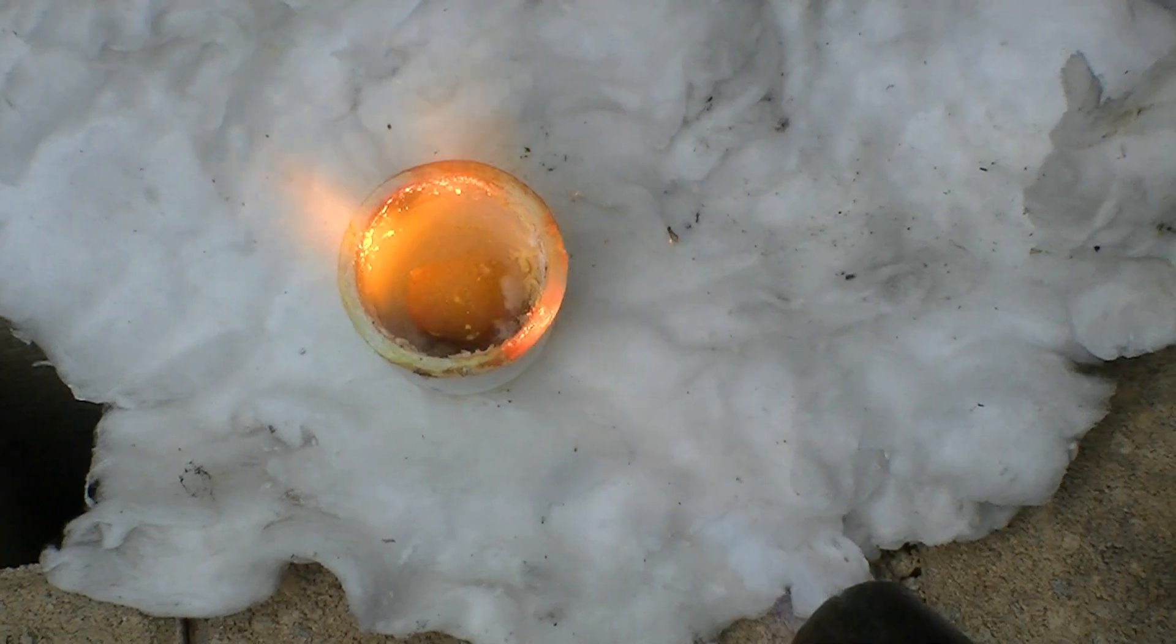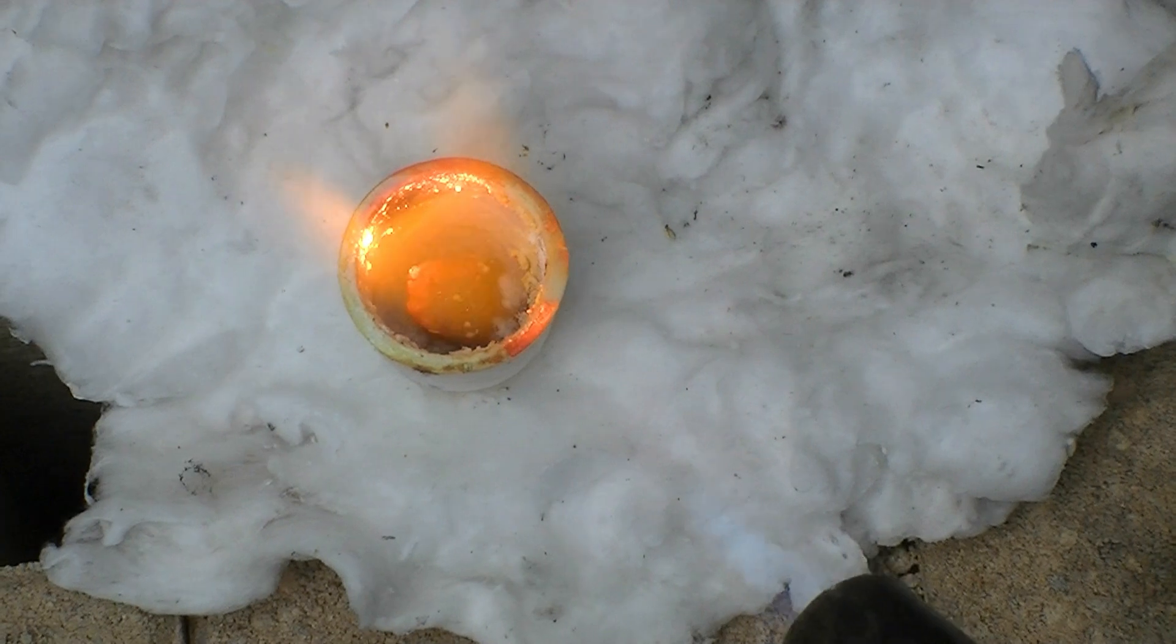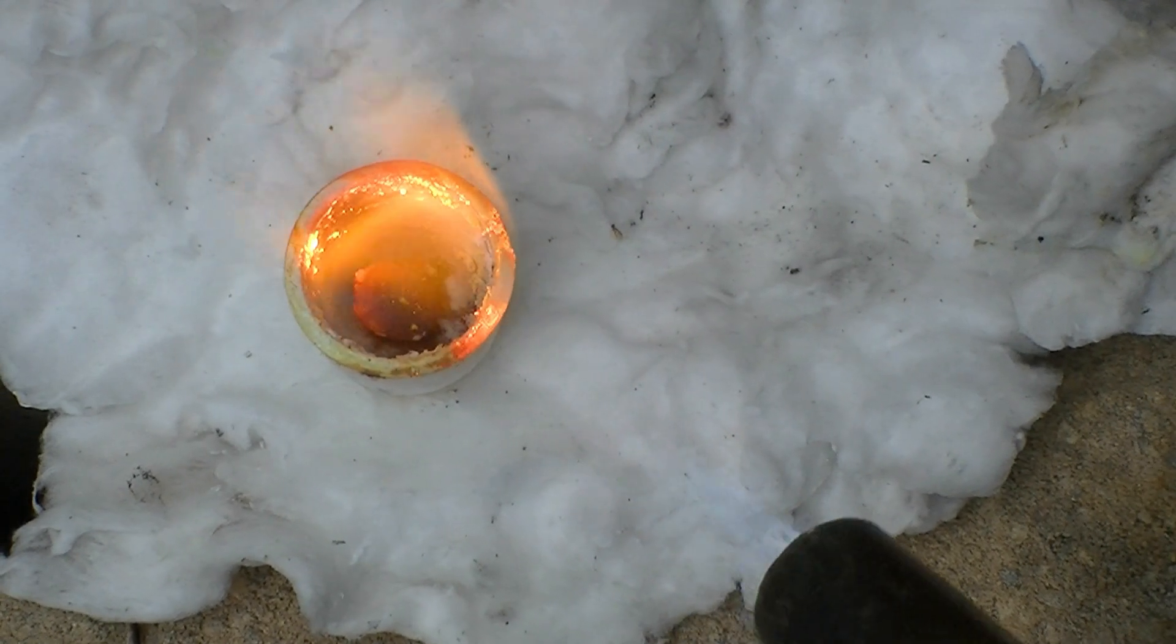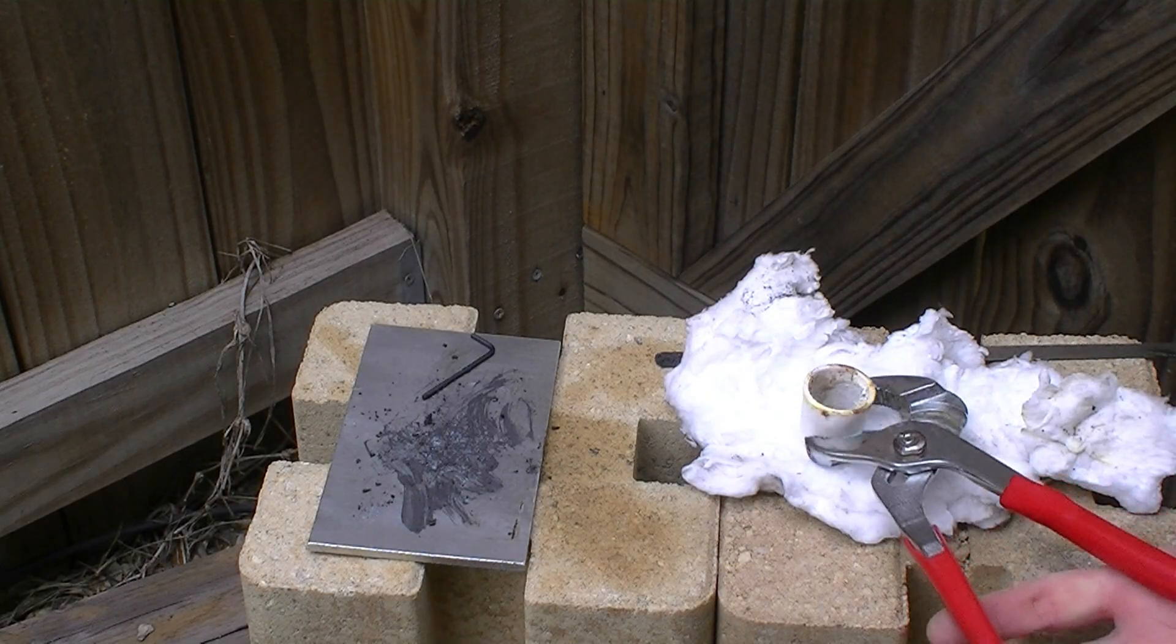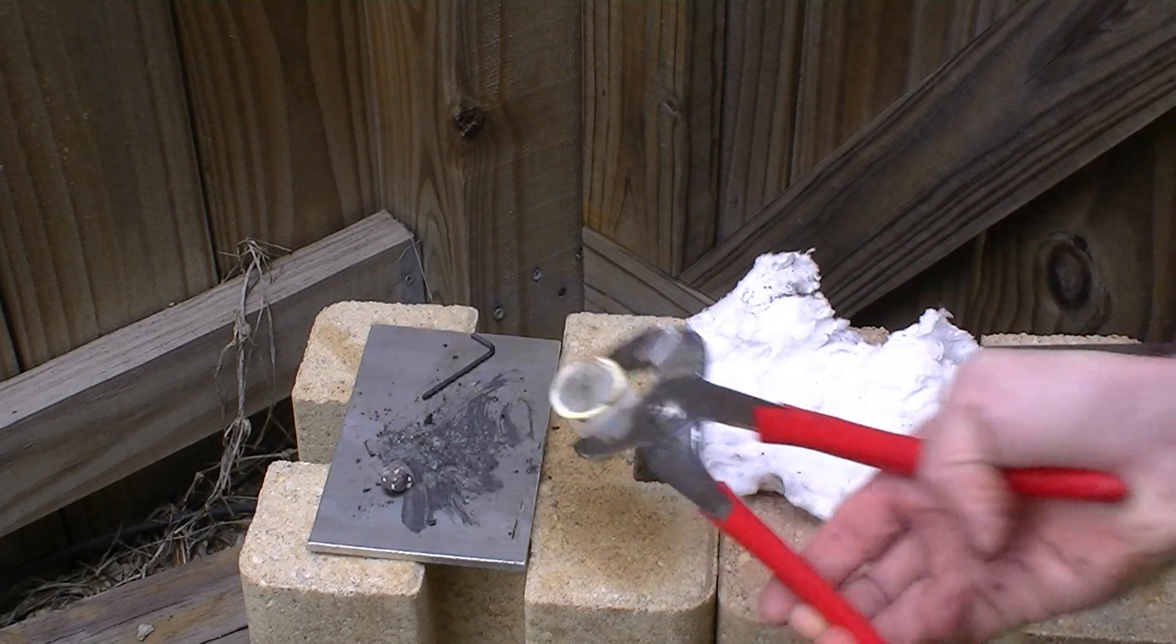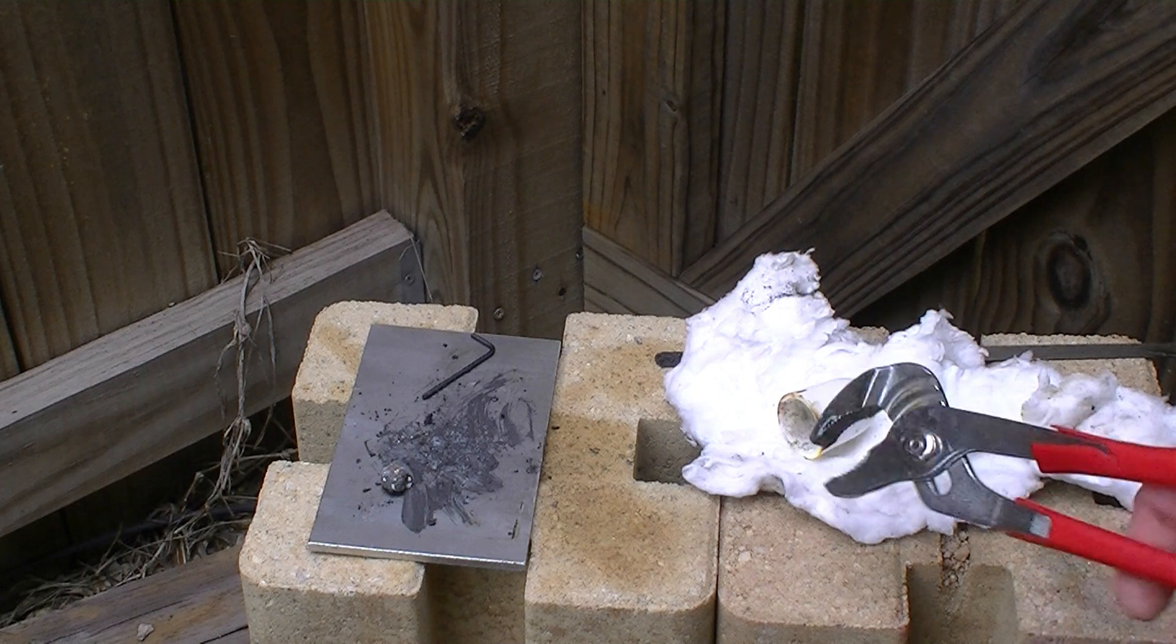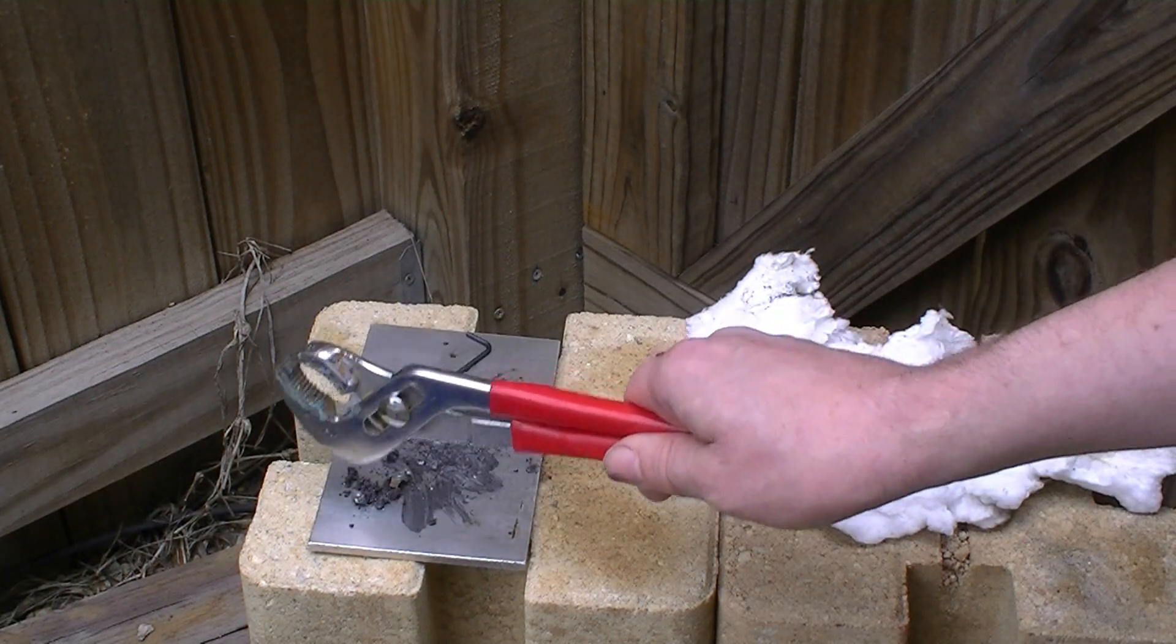On heating, there are competing reactions occurring. Our goal, of course, is to melt the bismuth and form a nugget. However, oxidation is also a strong possibility. As melting is not performed in an inert atmosphere, oxygen is present. The product before we were heating was also moist with water, as the previous filter product was not fully dried out at low temperature. So oxidation is also a possibility.